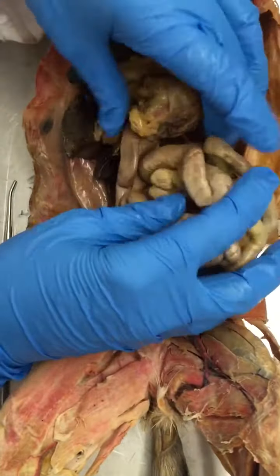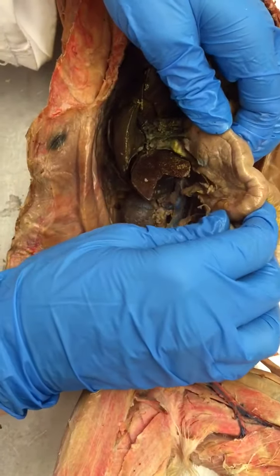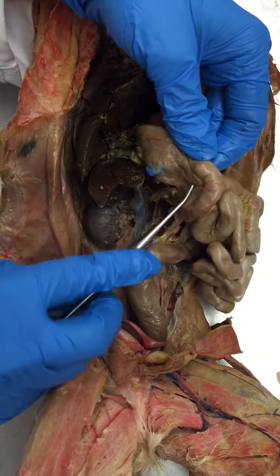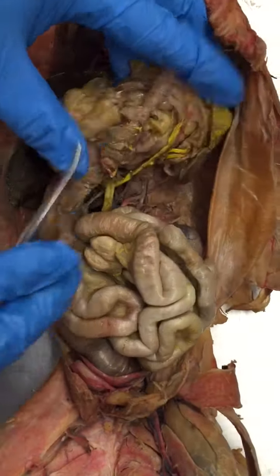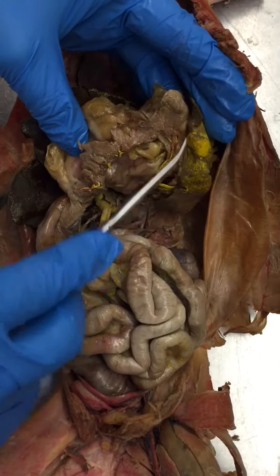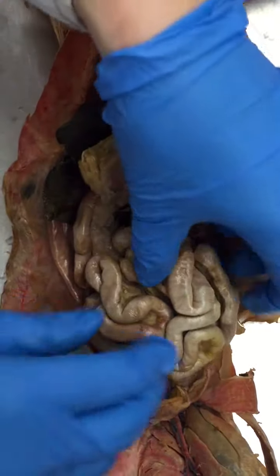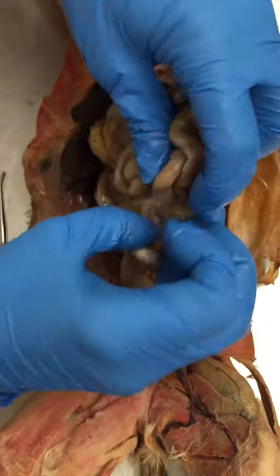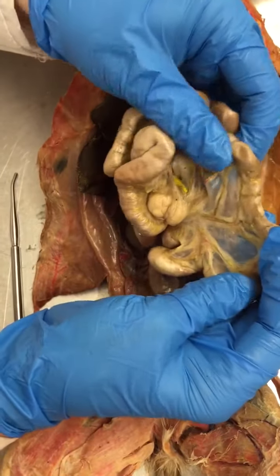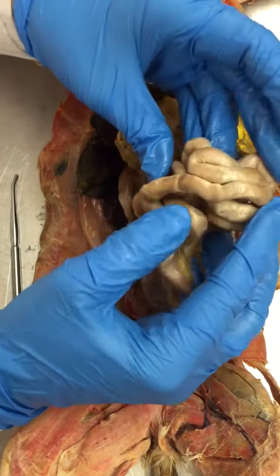If I take the small intestine, you can clearly identify the duodenum — this first, shortest part — and it has the pancreas up against it. The pancreas is also visible under the greater omentum, right along the edge of it. The pancreas is very long; it stretches from the spleen on the cat's left side all the way over to the duodenum. When I pull up on the small intestine, you see another membrane with blood vessels running through it — that's the mesentery proper — and it anchors the small intestine in place. It's a fan-shaped membrane associated with the small intestine.